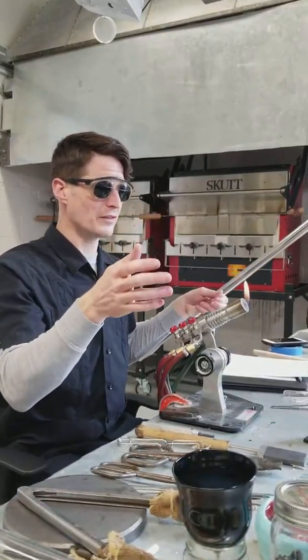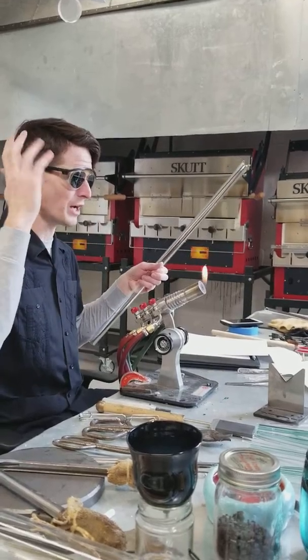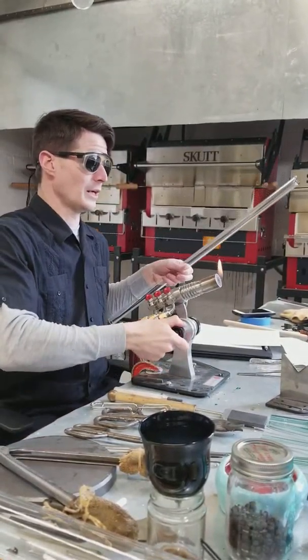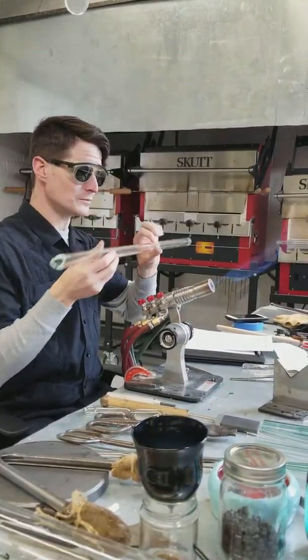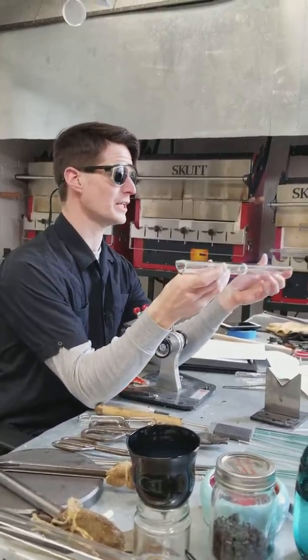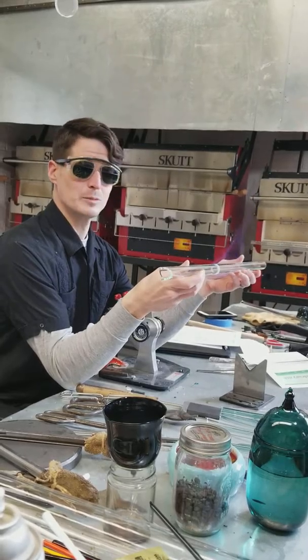I apologize that I'm going to be saying a bunch of stuff — just try to follow what you can because I know it's going to be all new. But we want a big flame annealing flame, and even though this is borosilicate I always treat it nicely and gently, as I would like to be treated.